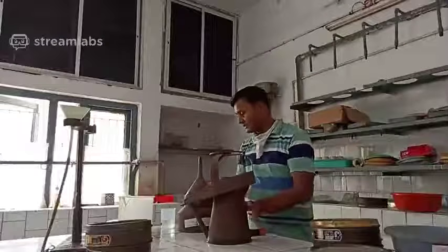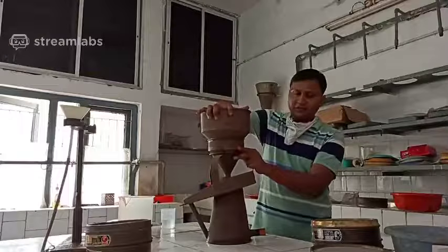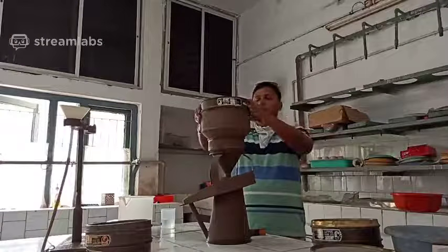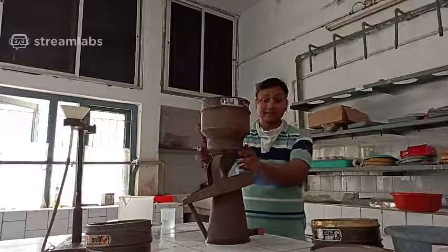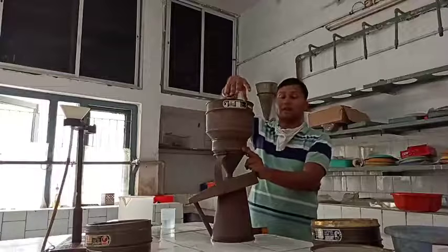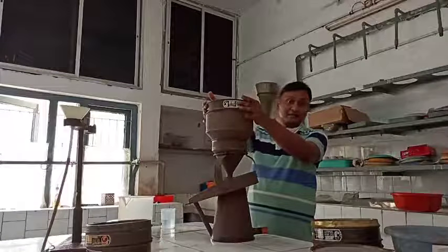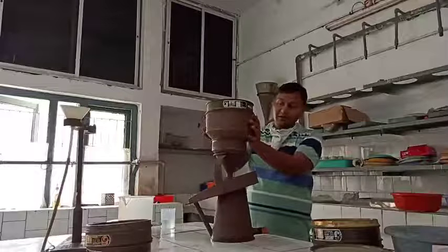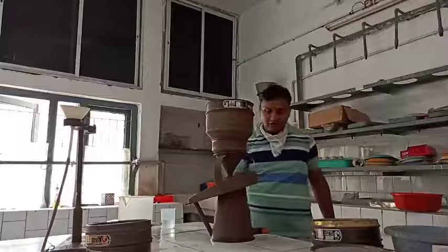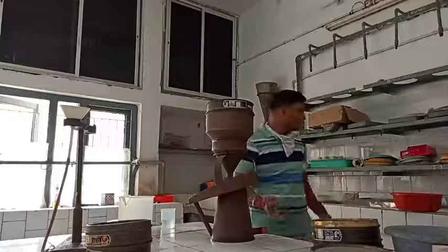This is a simple method in which you put a 16 mesh sieve on the top, so that the root debris and heavy soil particles will be separated on the uppermost 16 mesh sieve, and the nematodes and soil will all come out at the bottom.